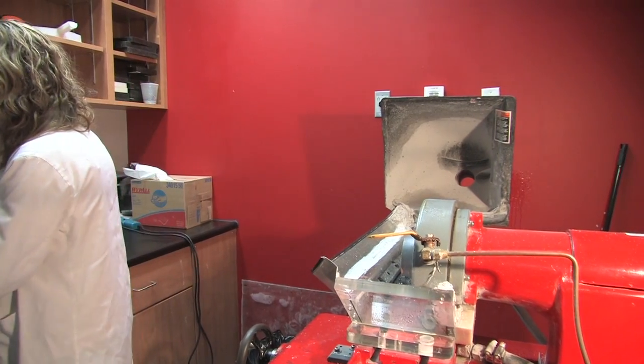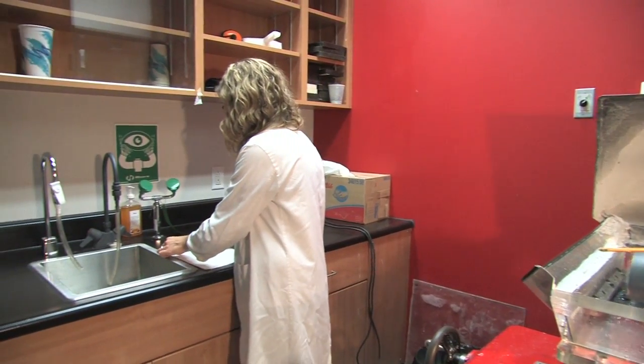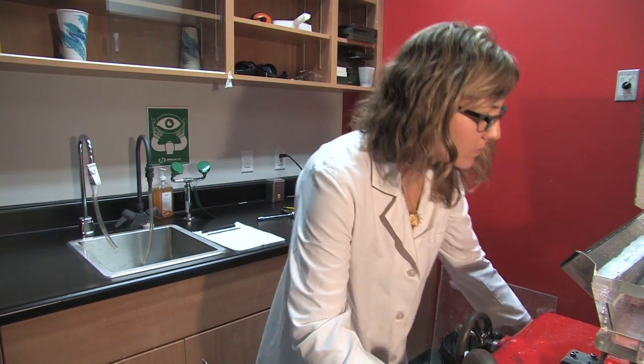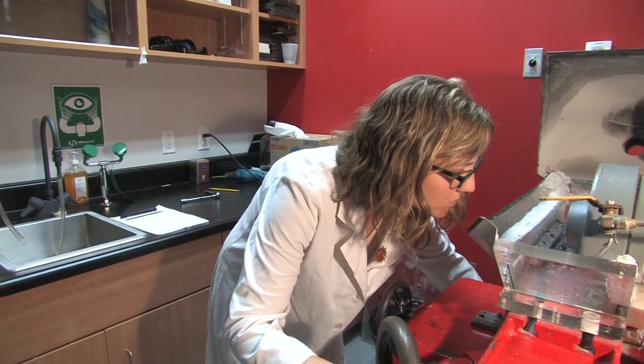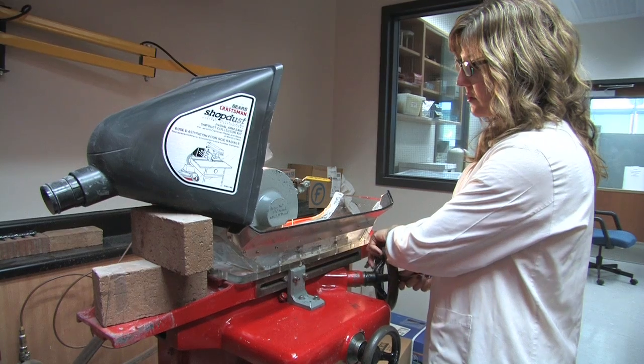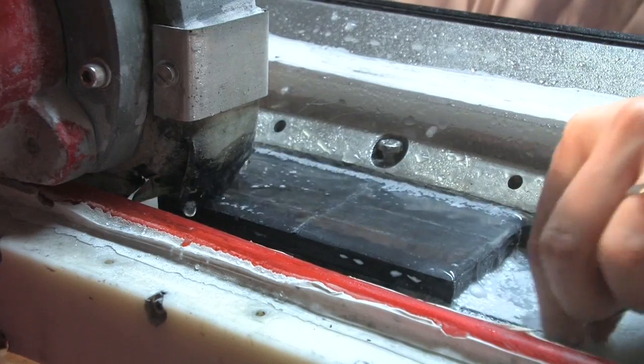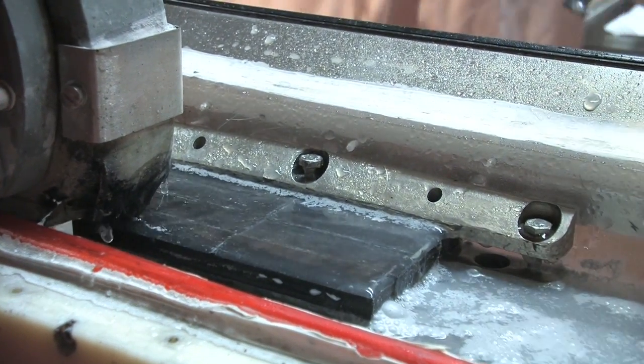This section will then be rinsed and dried. Repeat this procedure until you have cut along all five grooves of the plate. And remember to keep each strip in order so as not to lose track of the samples.